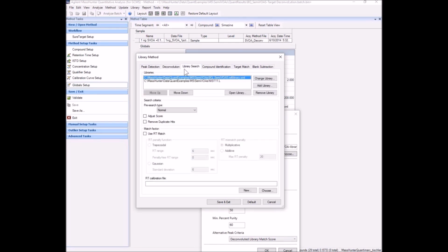The main item here is that we've set up the library search to search two libraries. The first one by convention is the reference library, and that's what's used to give you the reference library match scores. That is not searching, that's just referring to a known library reference and giving you a match score. This second library by convention is used to do the searching in target deconvolution 2. And we've set up the NIST library here, NIST 11, and that will go ahead as a second library and be used to search for alternative hits.